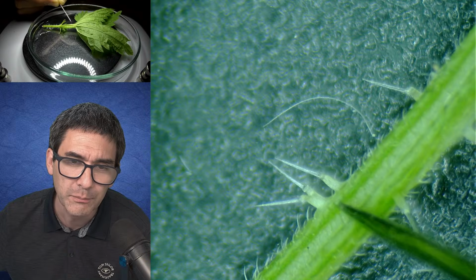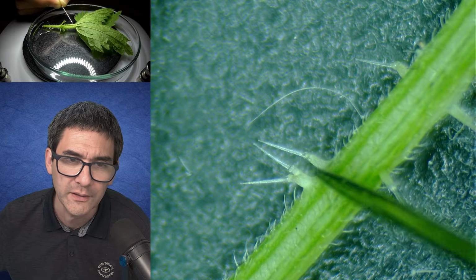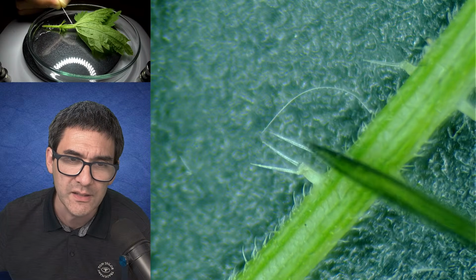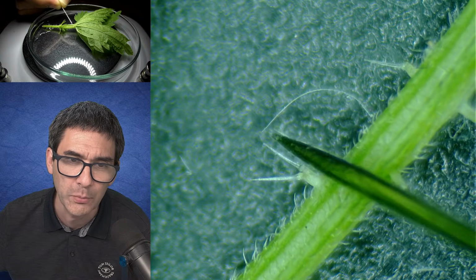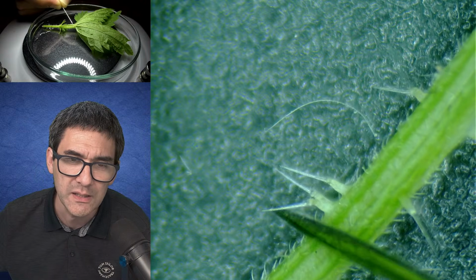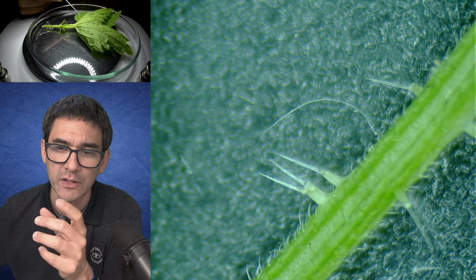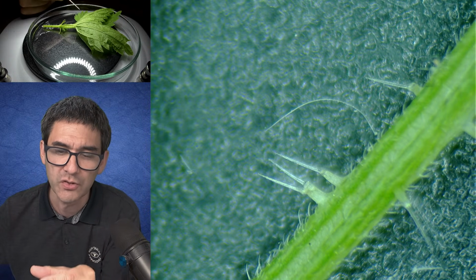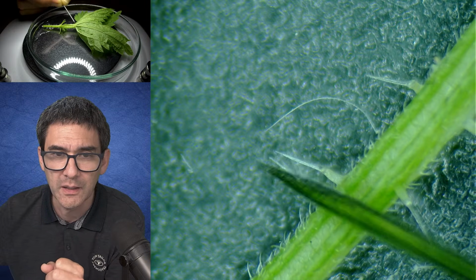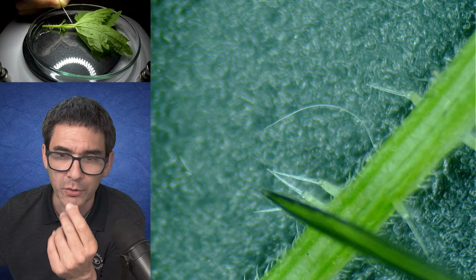Okay. But I would like to try the following. I would try to cut this off and make a slide to have a look at this using my compound microscope. Essentially what this means is that if you pick stinging nettles, you don't touch them like this, but you have to kind of stroke it a little bit and then touch it, because this will bend over the spikes so that they cannot puncture your skin.